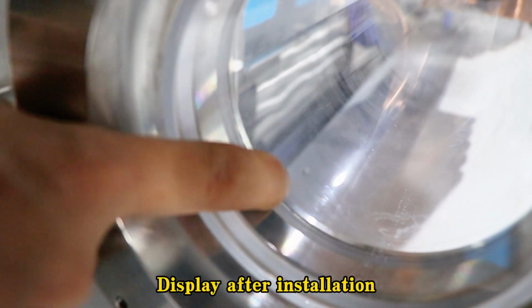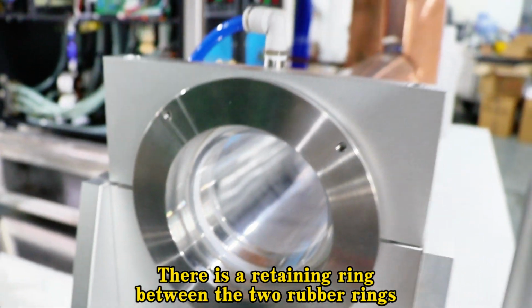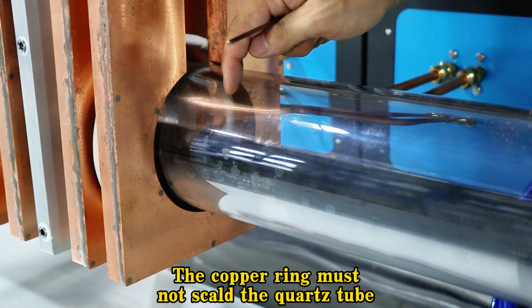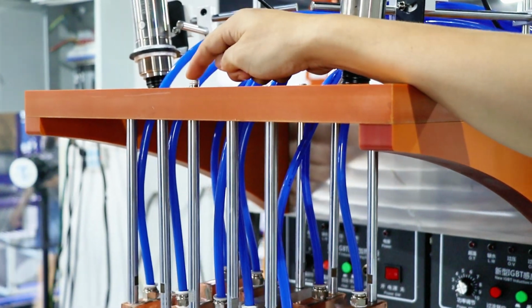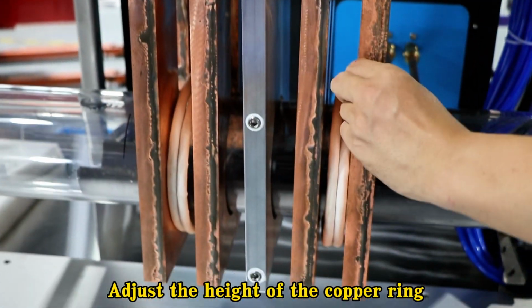Display after installation. There is a retaining ring between the 2 rubber rings. There must be a gap maintained between the quartz tube and the copper ring. The copper ring must not scald the quartz tube. If the copper ring is close to the quartz tube, the height of the nut can be adjusted at the top. By adjusting the height of the nut, adjust the height of the copper ring.